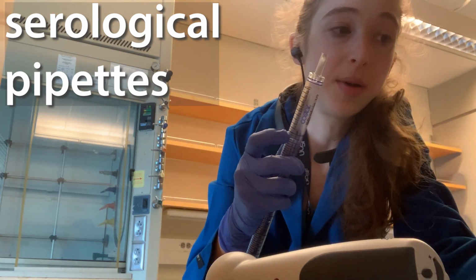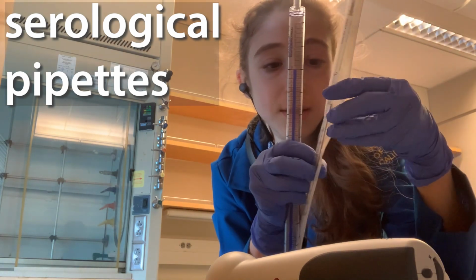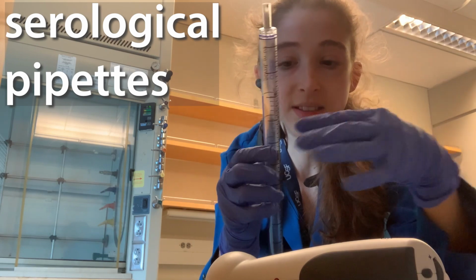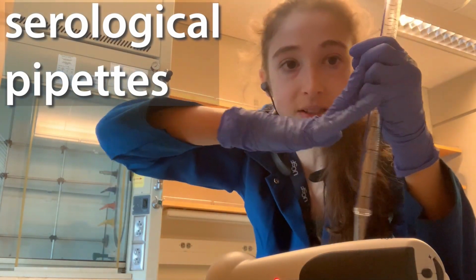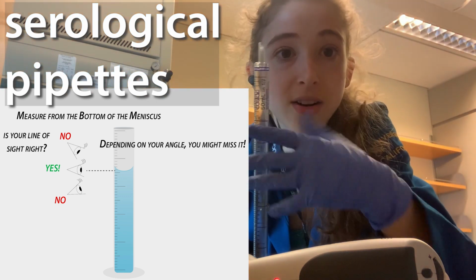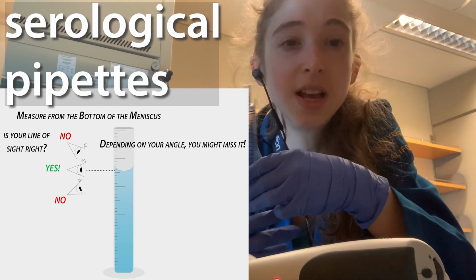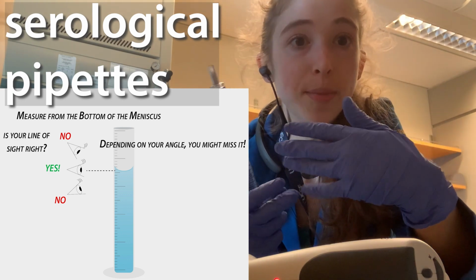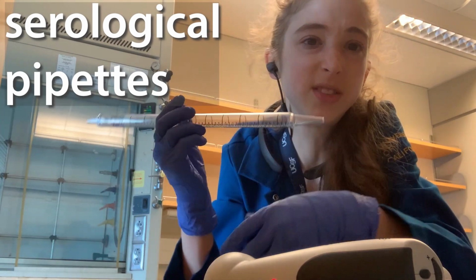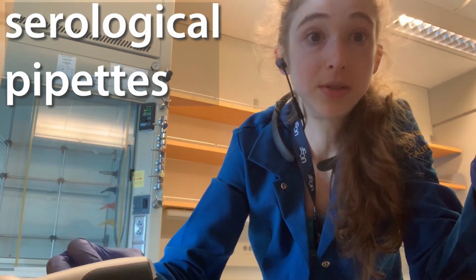And remember, the smaller the pipette size, the thinner and narrower this is going to be, the more space between the different lines, so you can have finer gradations than you would have with one of these. When you have one of those thinner ones, you're going to have a more distinct meniscus. With one of these big ones, it can be kind of hard to actually see the meniscus. But when you're using one of these big ones, you often don't care that much about exact precision, especially because if you're a little bit off, it's just going to be a drop in a bigger volume as opposed to a drop in a smaller volume. So we often use these when we're transferring large amounts of liquid from place to place, and we're not as concerned about the precision.